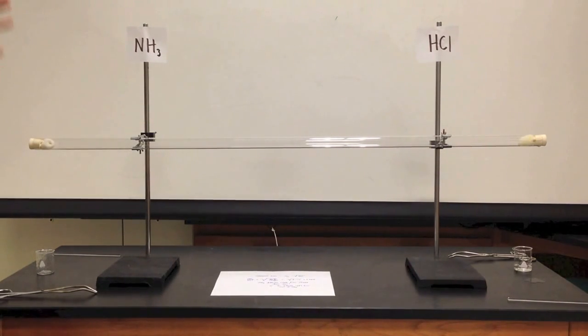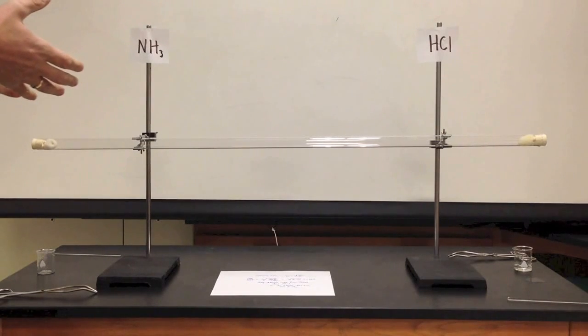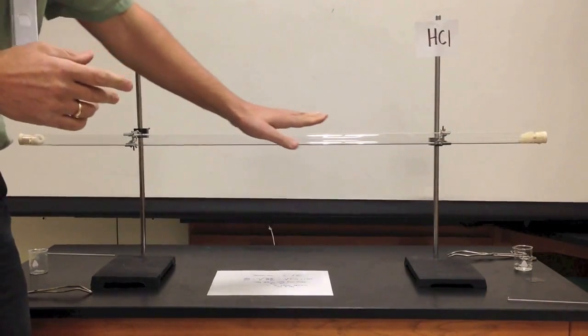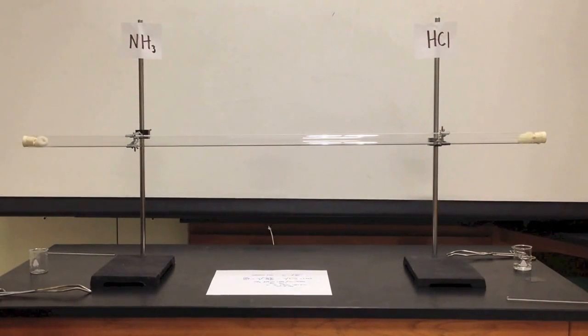Therefore, its velocity at the same temperature is going to be greater. And we should be meeting somewhere, I believe, toward the hydrochloric end.